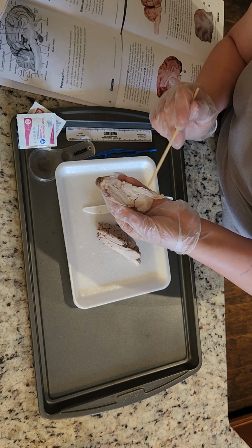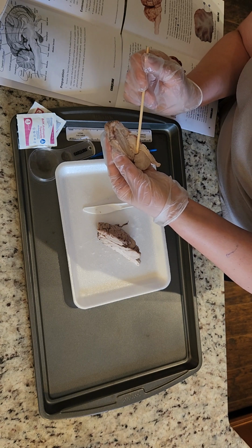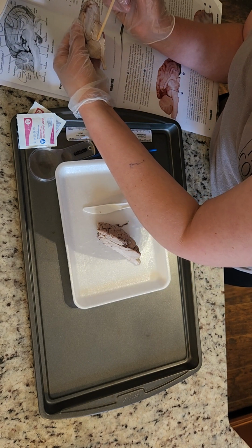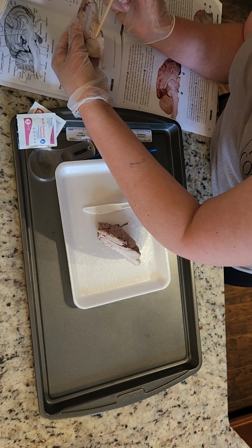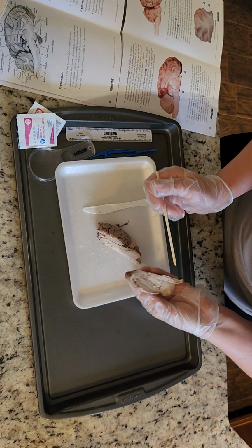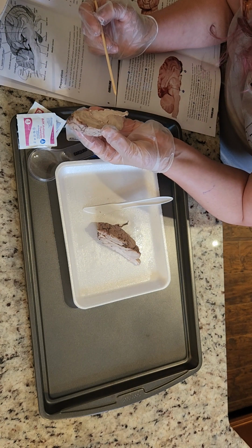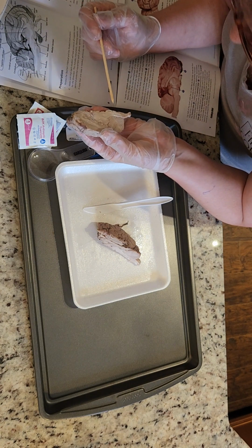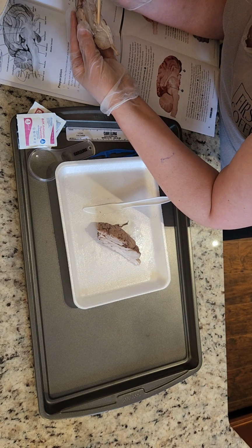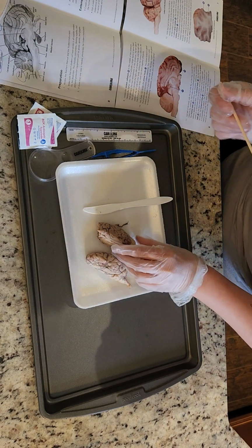No, the colliculus. Sorry, I think out loud when I talk. I'm trying to find it. I don't know why I can't find it.